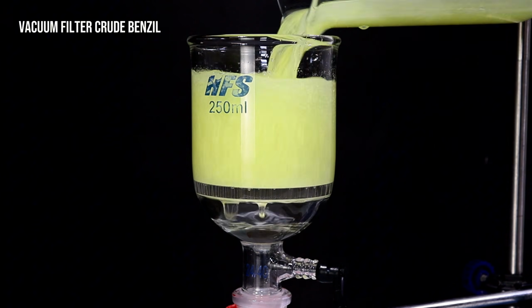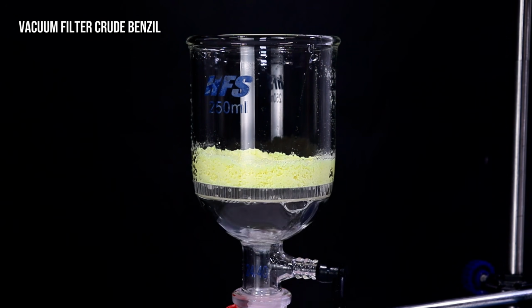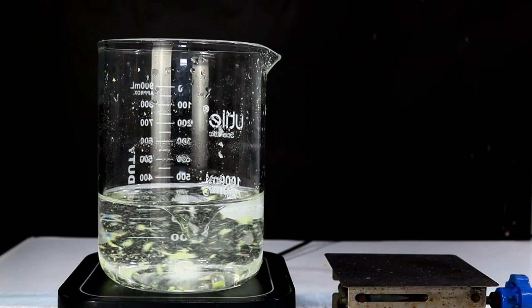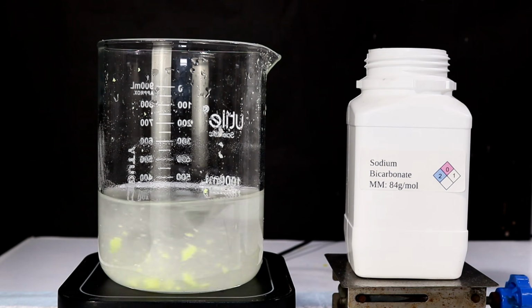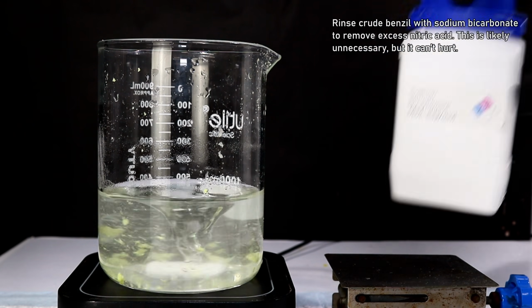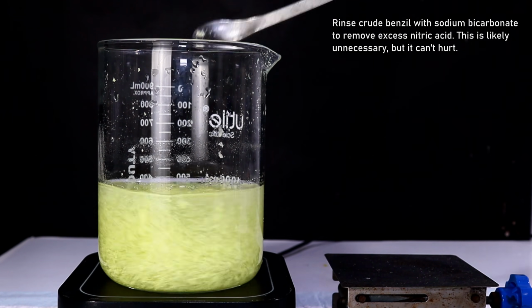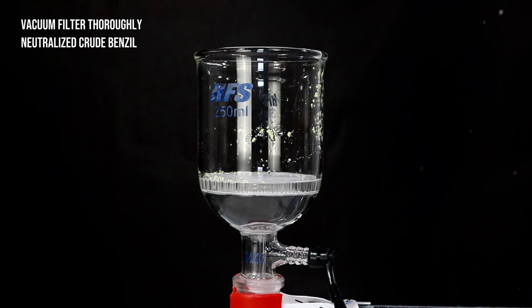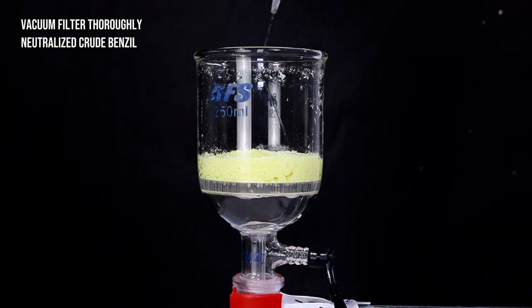Anyway, I then collected the crude product in my Buchner funnel and rinsed it thoroughly with a bit of cold water to try and remove any residual nitric acid. For the next step, I decided to transfer the crude Benzil back to the beaker and rinse it with a large excess of sodium bicarbonate to try to neutralize any excess nitric acid. This step might be entirely unnecessary, as it wasn't part of any of the procedures I read, but I felt like it couldn't hurt, so I decided to do it anyway.